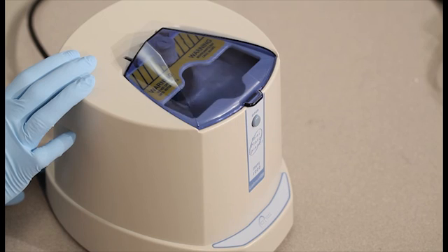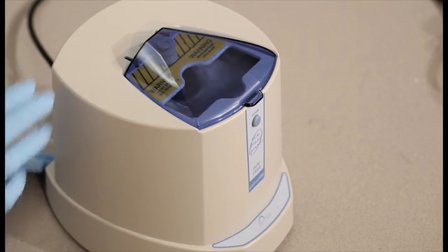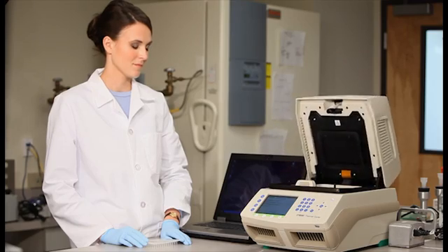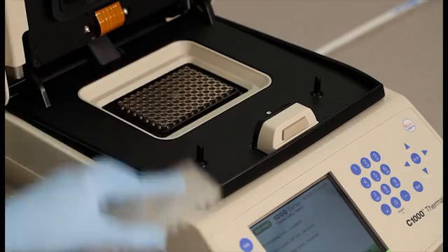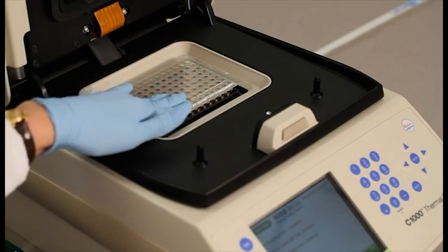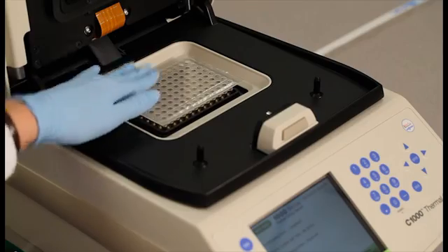The next step is to initiate the qPCR run. Open the lid of the Bio-Rad CFX-96 real-time system and seat the plate in the machine. Close the lid.